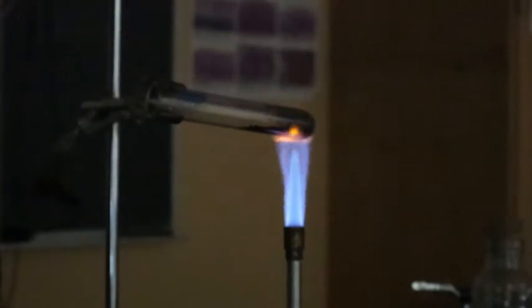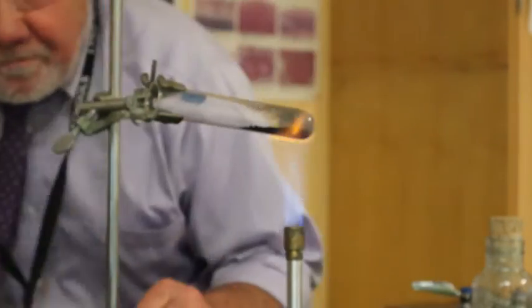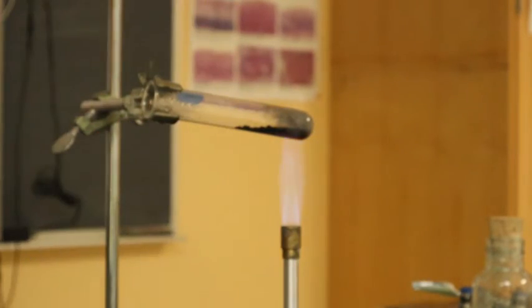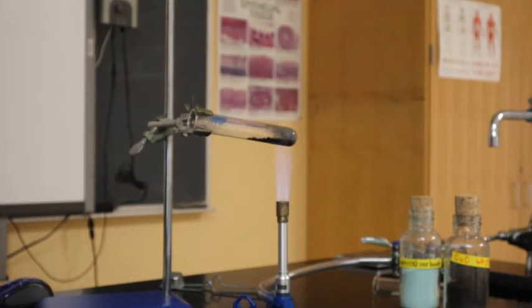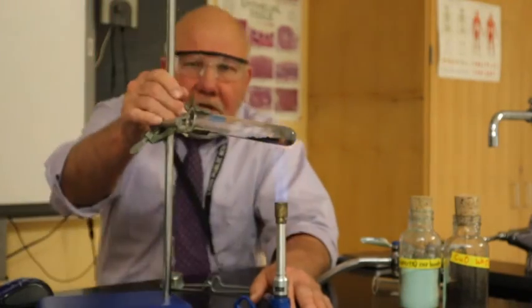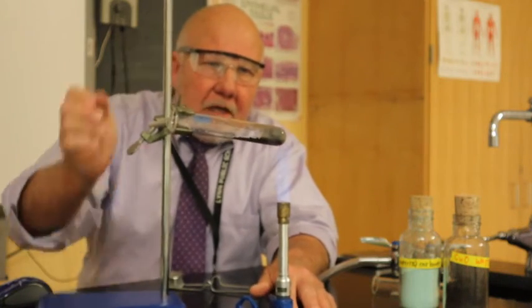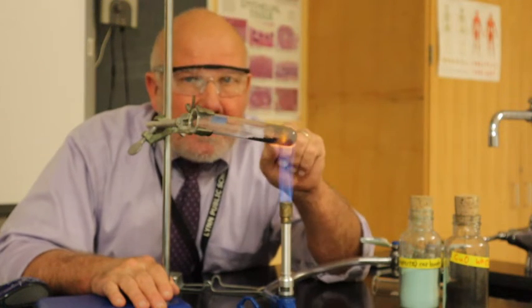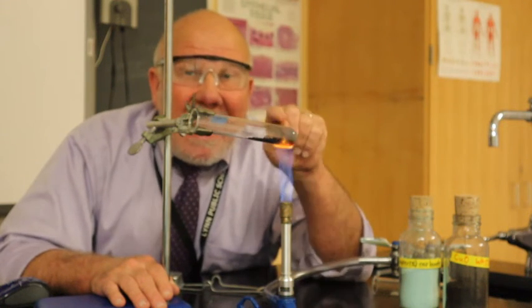All right. So let's come back. Turn the light on for a minute. A little bit better. And I'm going to just keep mixing that up a little bit. And so, as I said, I'm really interested in the yield of that. The actual yield will be how much I actually produce once I've stopped heating this. Once I've stopped heating this, which I'm going to go about another minute because it looks pretty good, I'm going to let this cool off. And once it's cool, then I'm going to measure the mass of it, and then I'll put it in the data table.